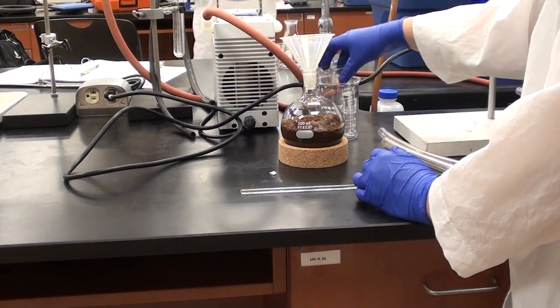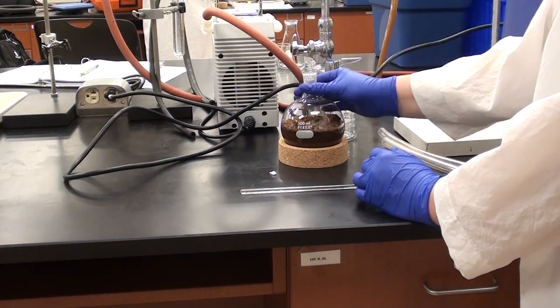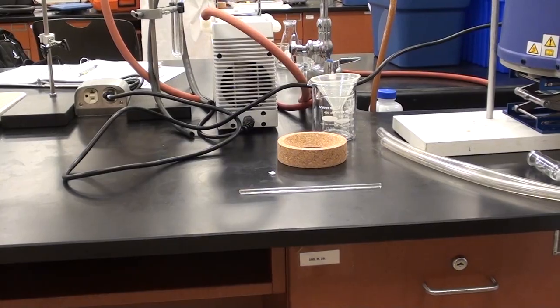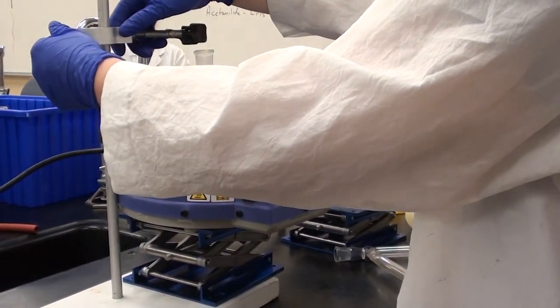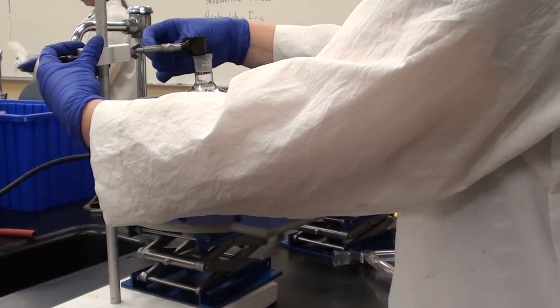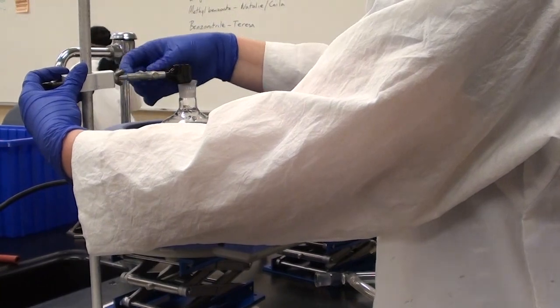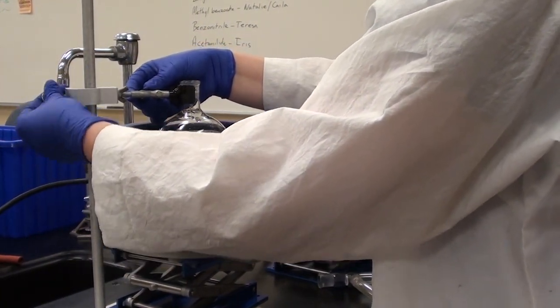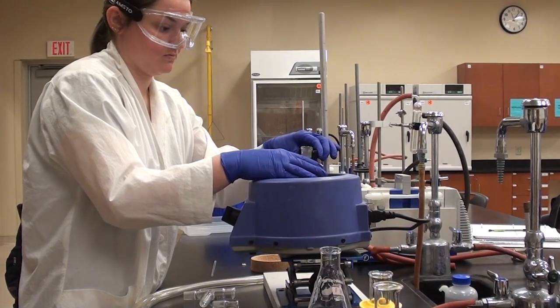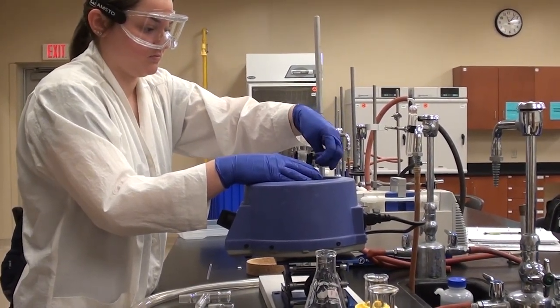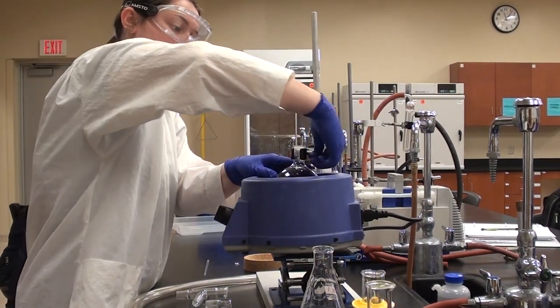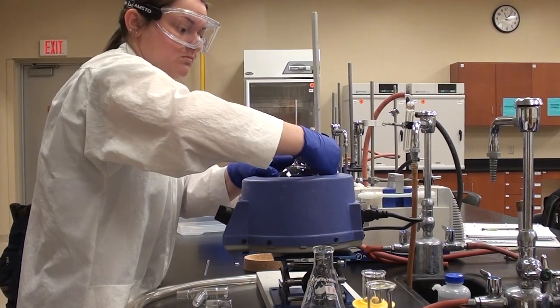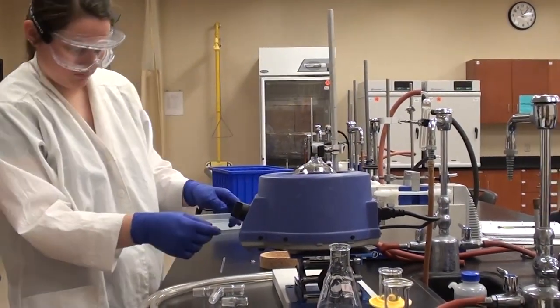That's ready to roll. Let's go ahead and put that into the clamp. You can actually rest it inside the mantle for now. She's going to arrange it so that the clamp is around the neck of the flask. She's going to make sure that that's secure because it is going to be out of the mantle occasionally as we do this.